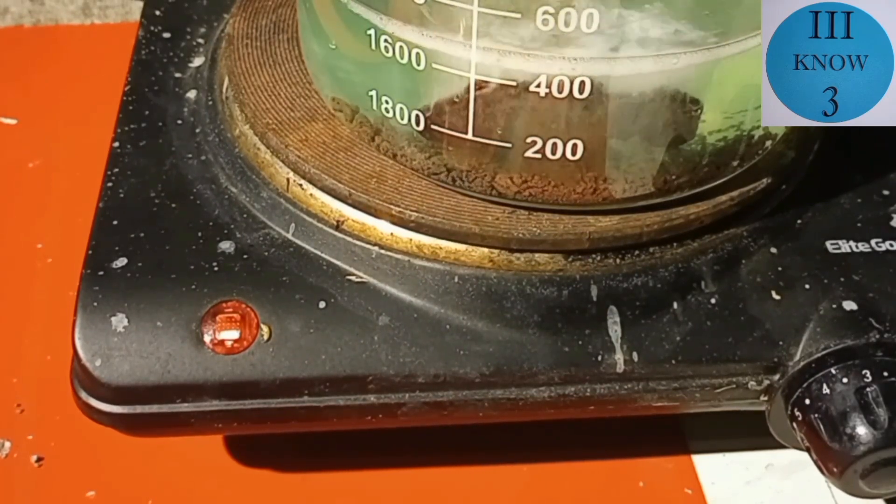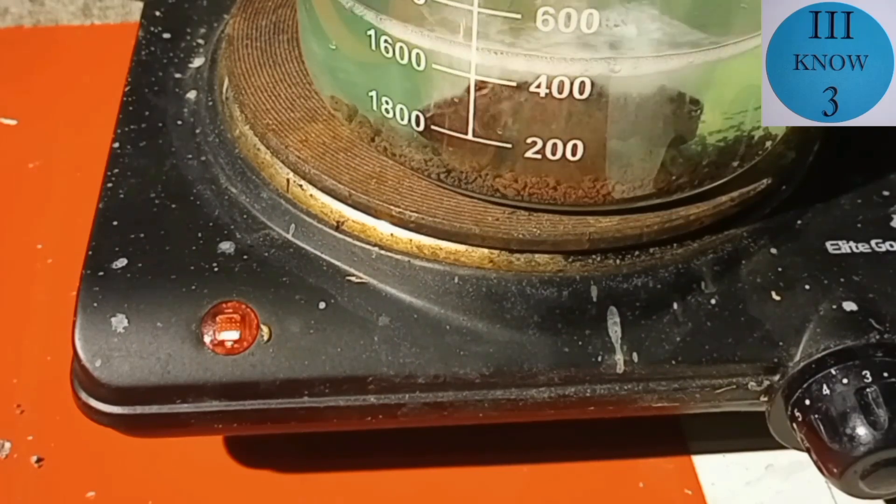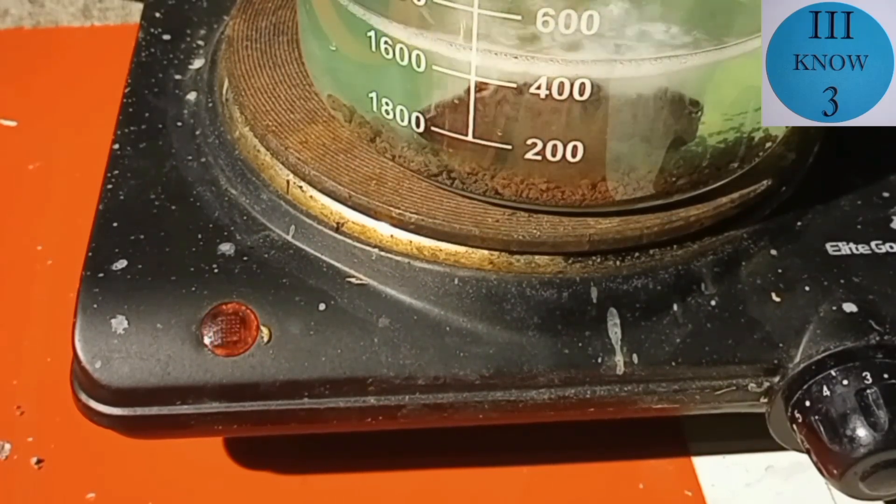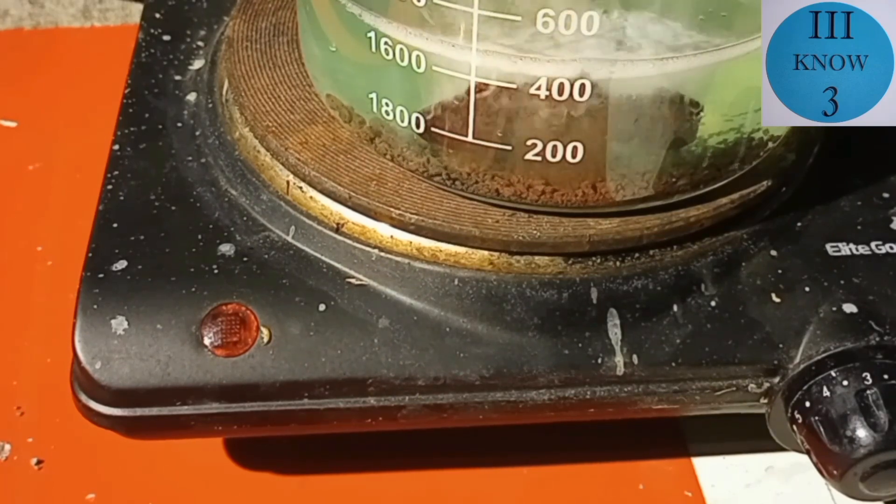Looking back at this now I wish at this point I would have taken all of that precipitated copper out. It may have made things easier later on.